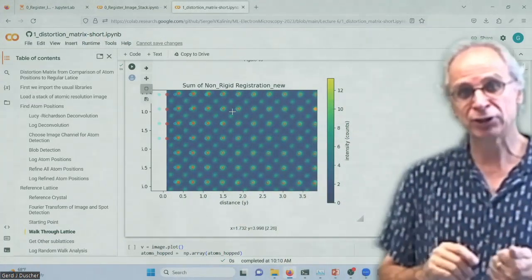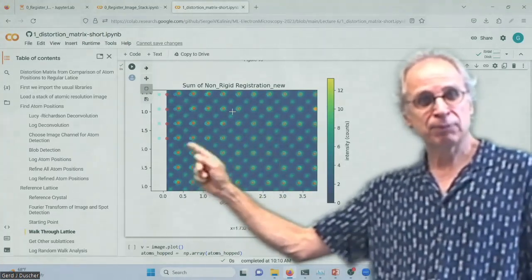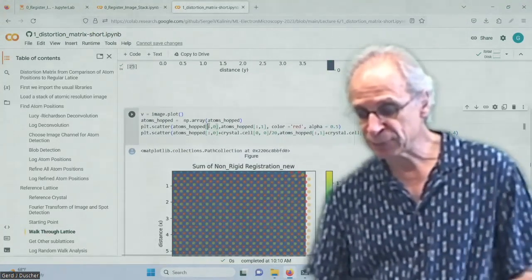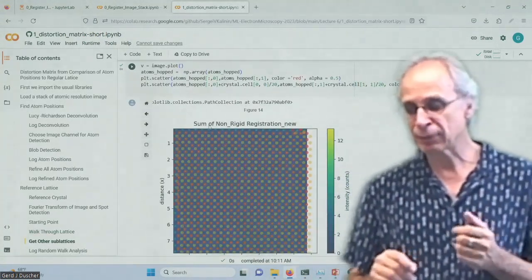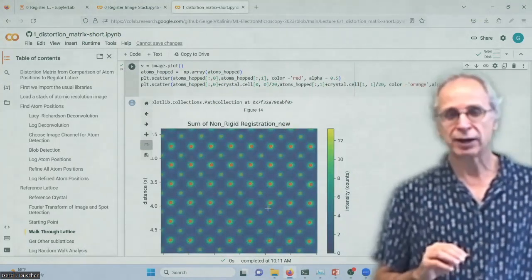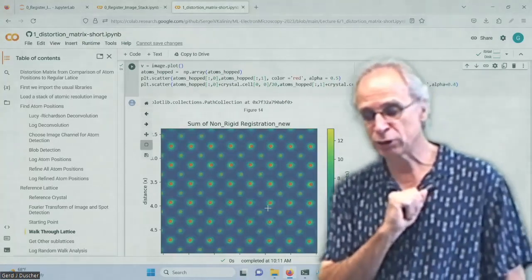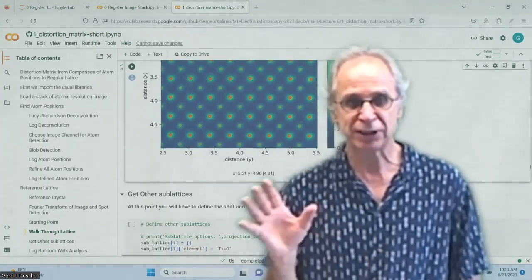So again, I steal it from graph theory, how I'm doing that, how I run through this kind of nodes. And then I have two positions now, one where the atom is and where it should be. And this is what I'm using. So this is the unit cell, but I can tell you where the titanium oxygen should be, and then I can tell you how much it is deviating by just looking at it. So that's what I did before, but after I did the deformation matrix. But we see already how powerful that is.